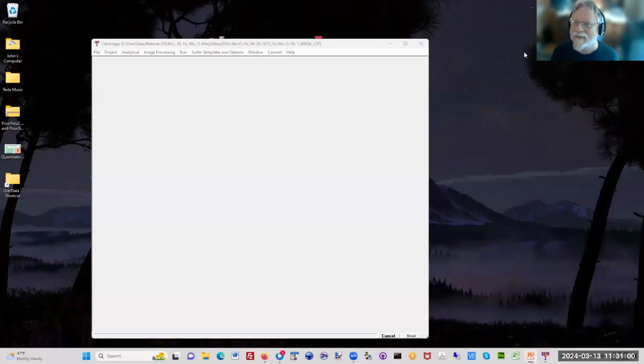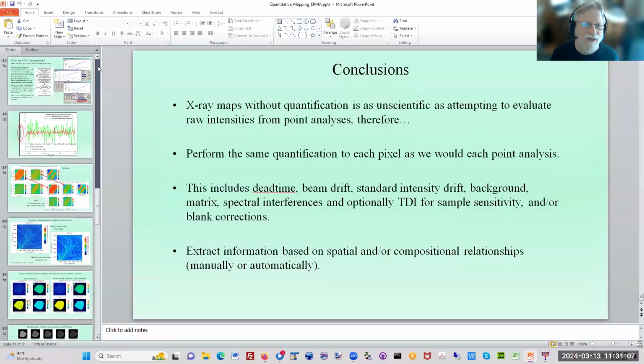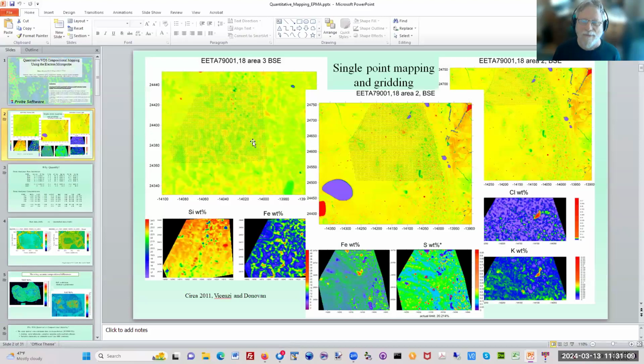If you will remember, at the very beginning of my talk I showed these maps that were done using single point analyses. The counting time on each point was like 10 seconds, maybe 5 seconds, because I was just trying to save a little bit of time. So I did a 5-second analysis, but it takes forever.